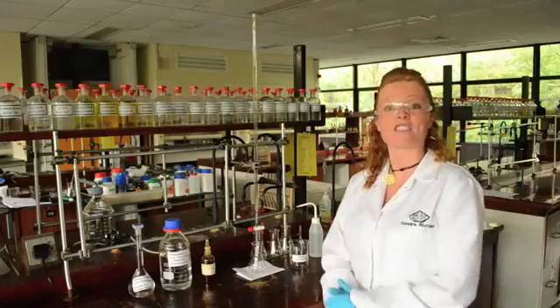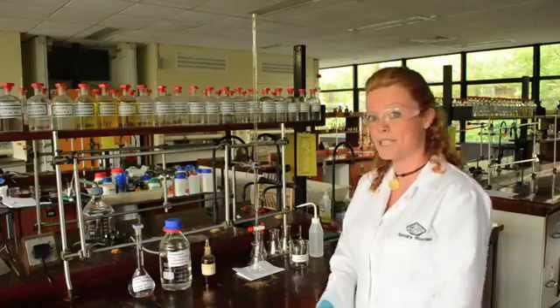I'll start the titration by rinsing all the glassware we need first with deionized water.